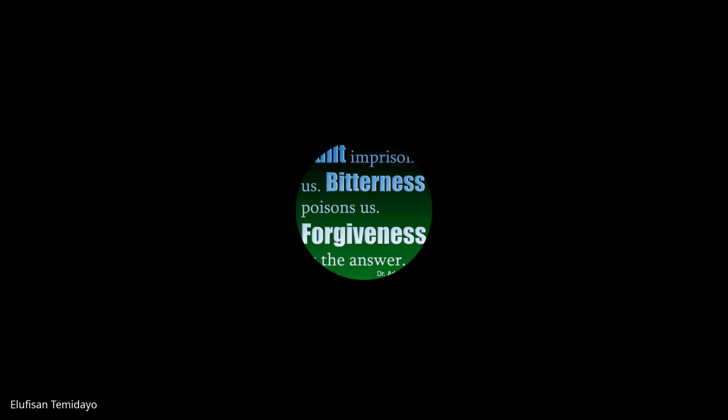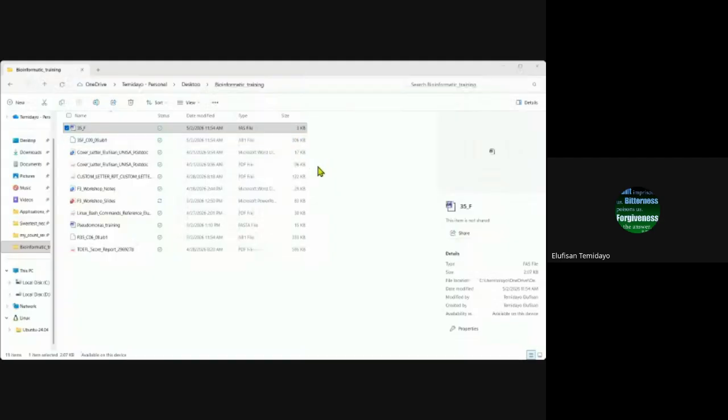Let me show you how I rename files faster. I'm coming to the download again, so you will see what I downloaded. Then I think you'll be able to see where I'm going to be saving it. I hope you can see it. Just a moment. Okay, I think I'm seeing it. That's good.